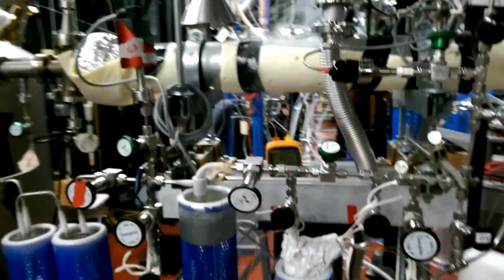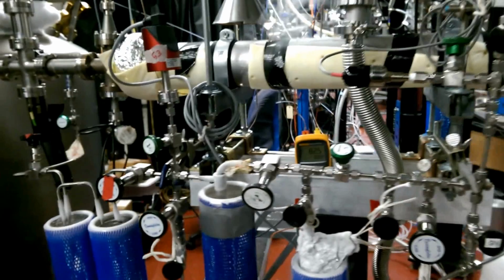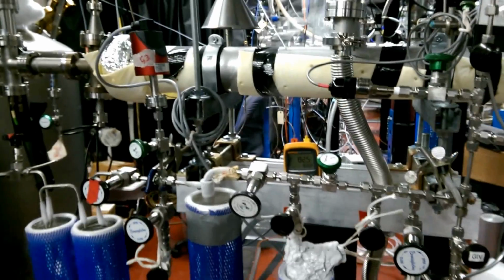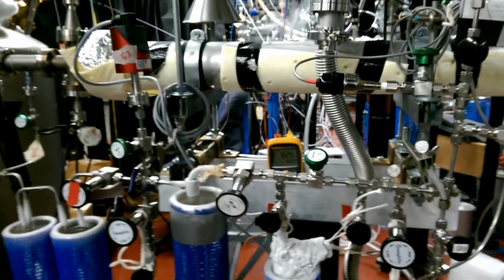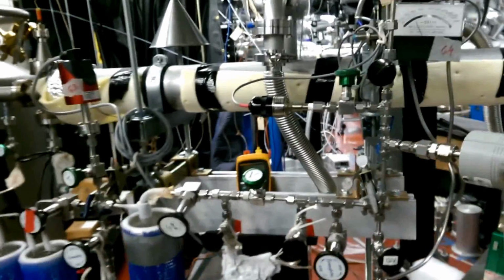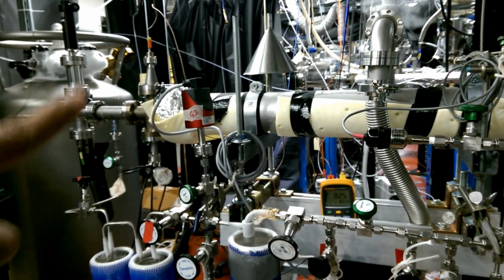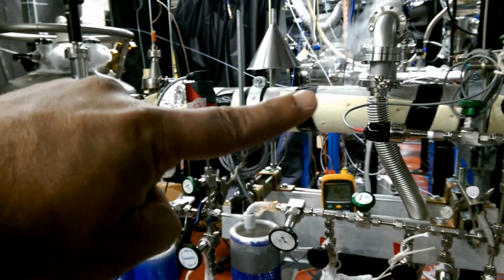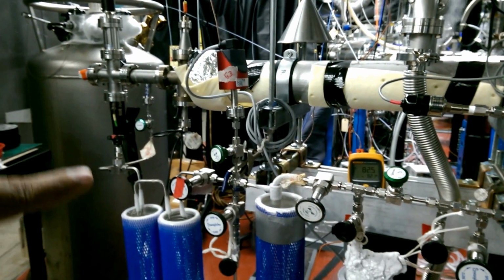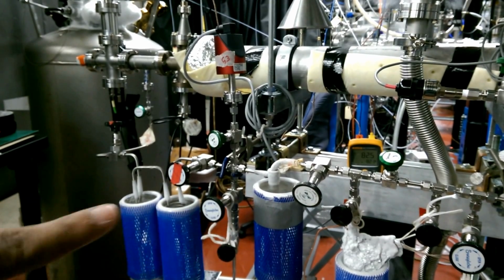So the basic idea is the CO will photodissociate and form C and O atoms, and in the presence of hydrogen, the reaction will take place to form CO2, methane, and water mainly, and some may happen outside the chamber. During its exit, some reaction may also happen. While all these are happening, we will trap CO2 and H2O in this cold trap, but some may slip through. That's why we have all three traps filled with liquid nitrogen, so we don't miss anything.